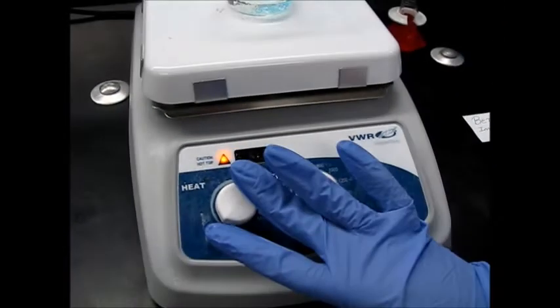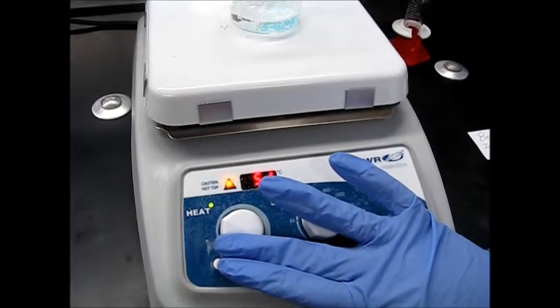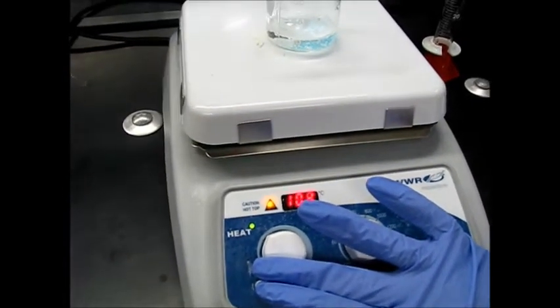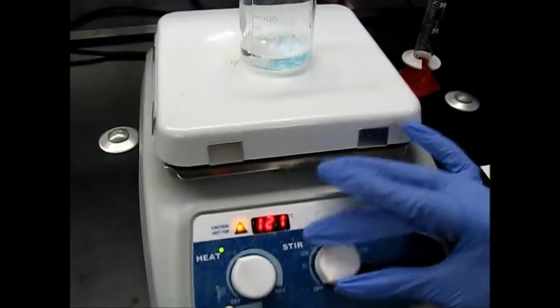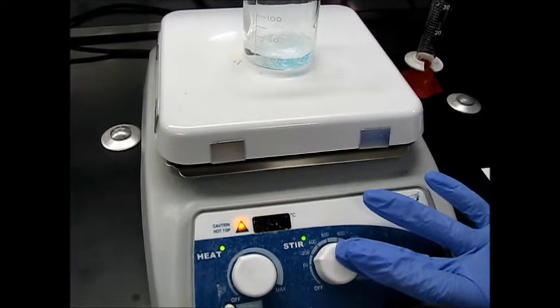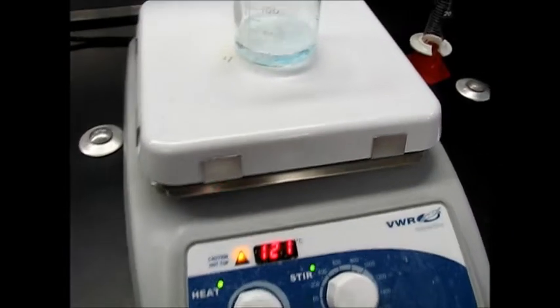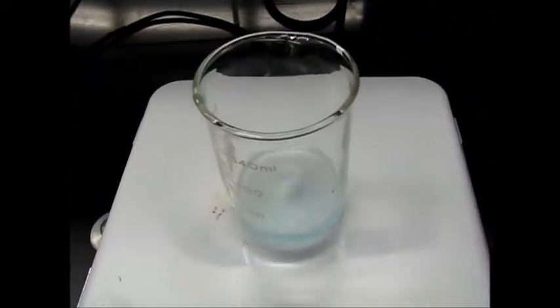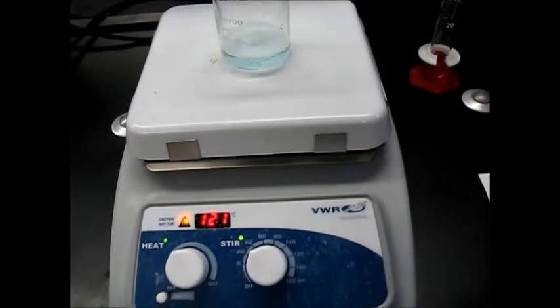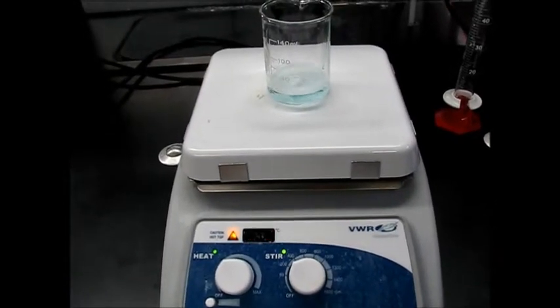Now I'm going to turn the heat to about 120 degrees Celsius. Here we are increasing a little bit hot, but after that we will decrease the heating. Then I'm going to turn up my magnetic stir bar to around 200. So now slow heating has started, and then we'll keep monitoring how our compound is dissolving, and after 5 or 7 minutes we'll come back to check how the compound is dissolving here.